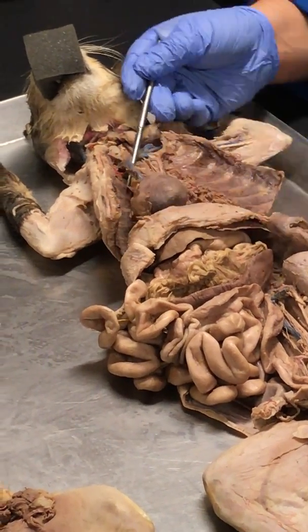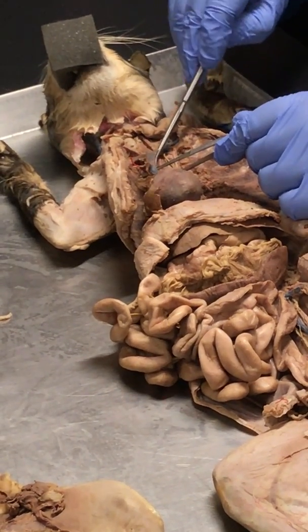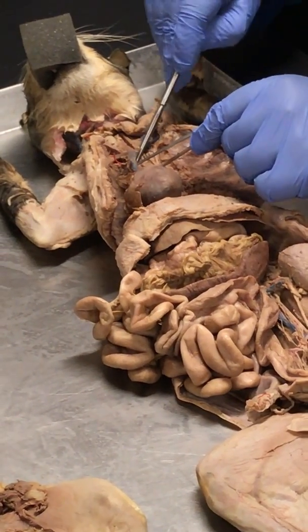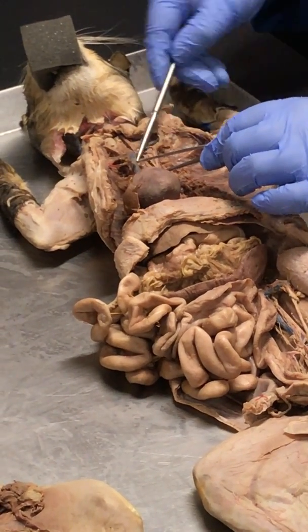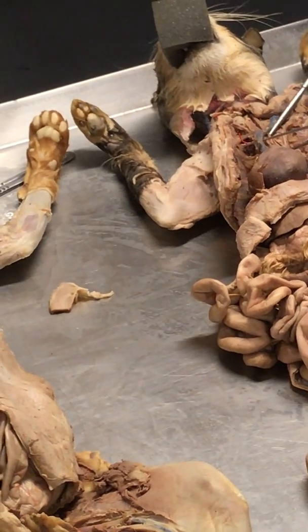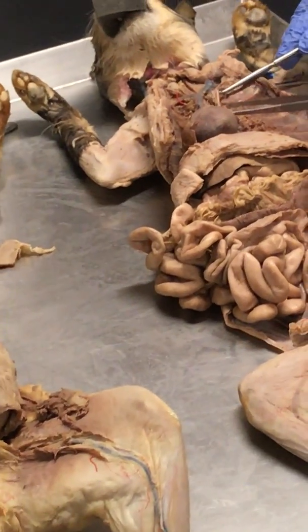And if I move this here, we now get to see three vessels right here. Oh, there's a third one. That third one right there, that's the right subclavian. Right common carotid artery, which is this artery here. And this one is the left common carotid artery, which is this one right here, which means that this is the left subclavian.